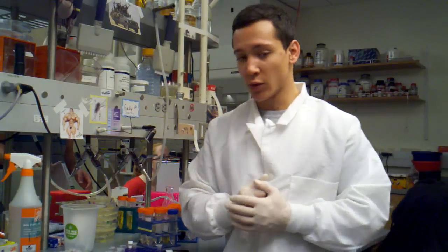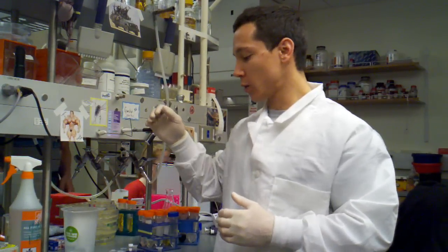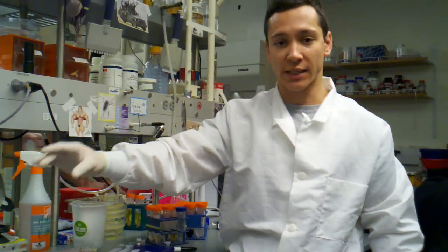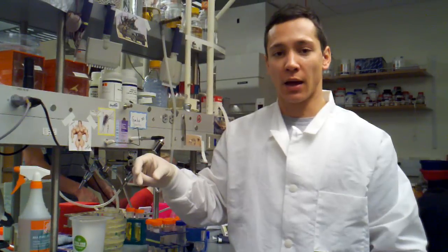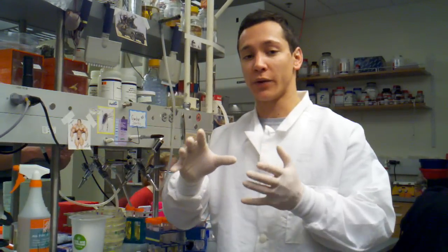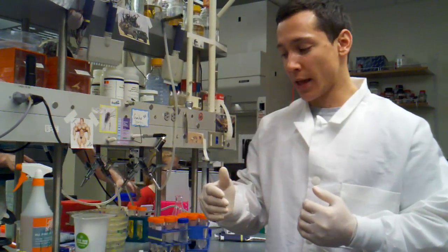This is spinning down. Let's do a quick review of the process so far. We started with a 2ml epi tube; we put in 2ml of overnight culture and put it into our centrifuge, spun that down for 30 seconds. We got a nice little pellet, discarded the supernatant, discarded the excess clear LB so that we're left only with that pellet. We resuspended that pellet in 250 microliters of P1, that allowed us to get into the buffering condition that will allow the rest of that mini prep to work. We resuspended by vortexing until that pellet disappeared, using those 2ml tubes, which will work a lot better than the 1.5ml tubes.